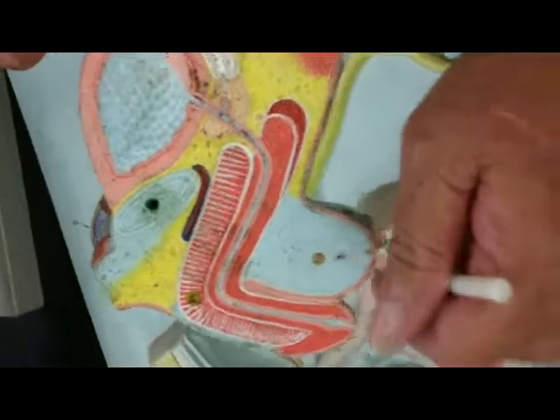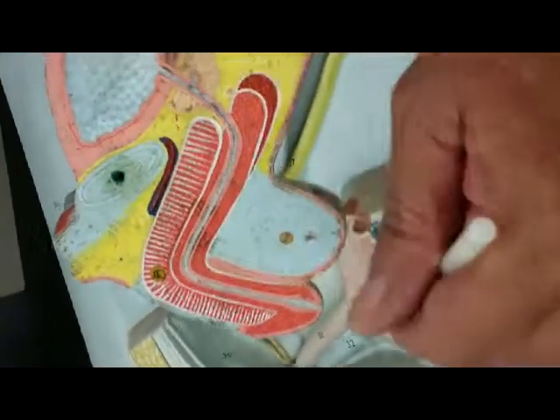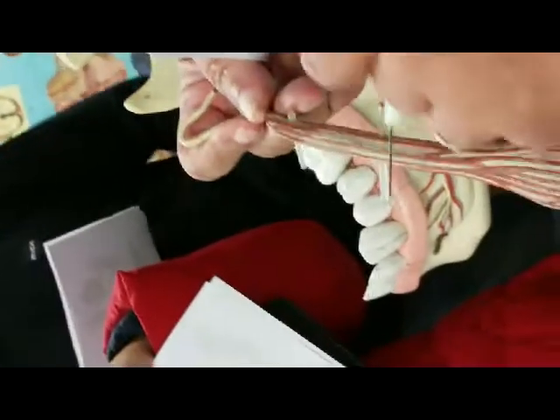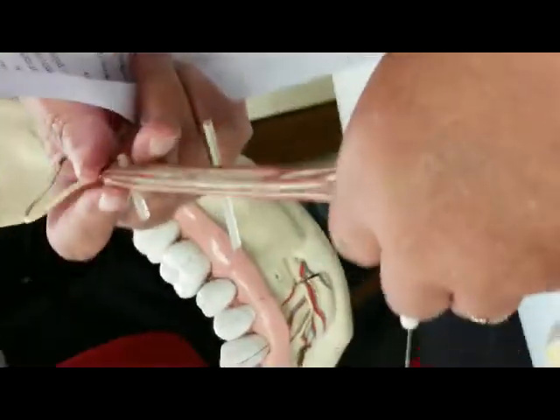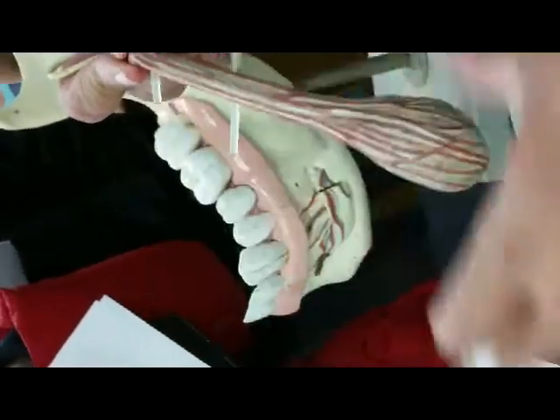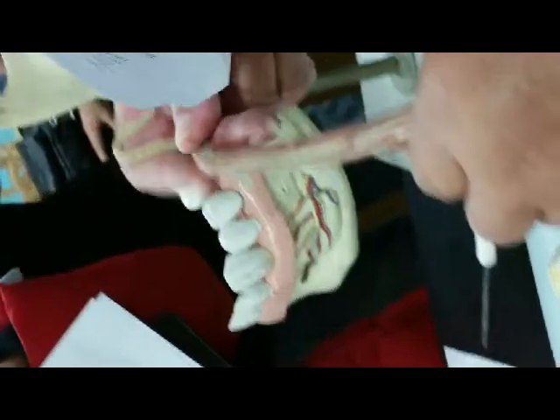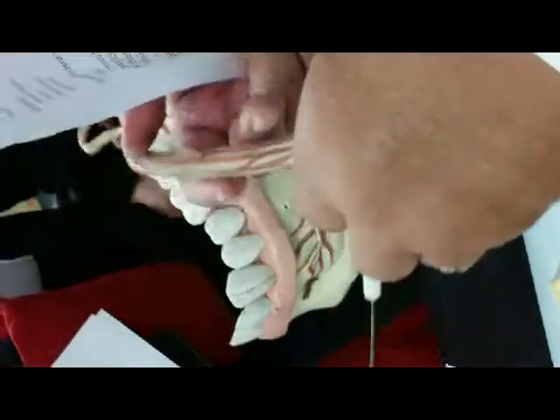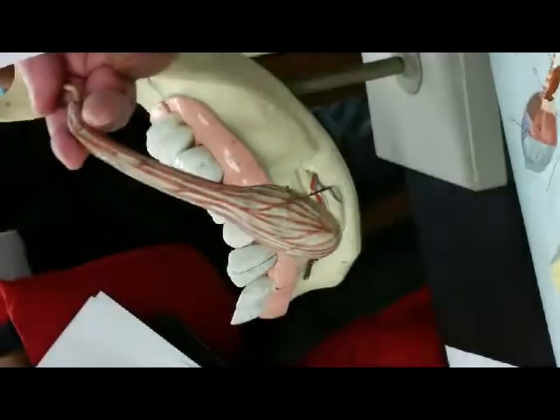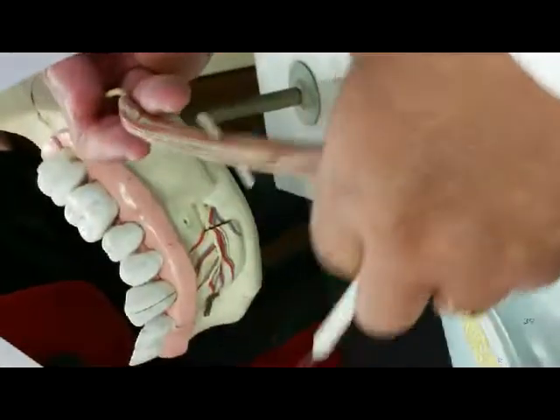And what would this be? Scrotum with the testis inside. And what do you think that this is now? See this on the test? No, it's not a sperm. The testis. And this is actually outside of the testis, the scrotum that has some muscles. These are muscles on the outside. So the outer skin is torn off to show the muscles. You'll hear about the muscles in the lecture, because during cold weather, these muscles contract and pull the testis closer to the body just to get some heat so that you're not killing the sperms.